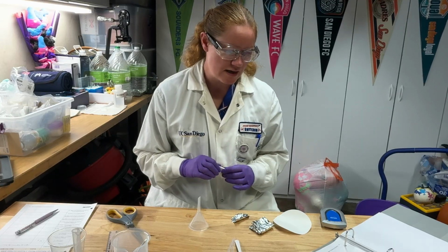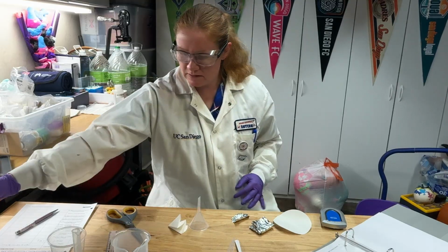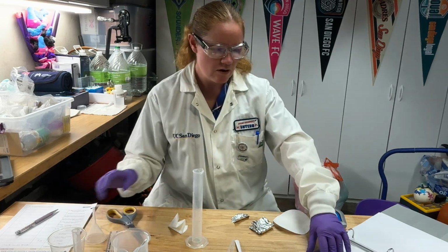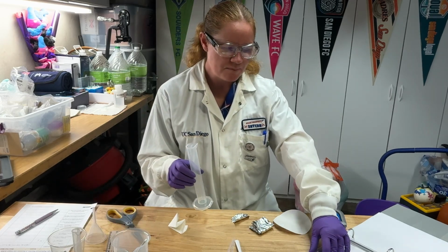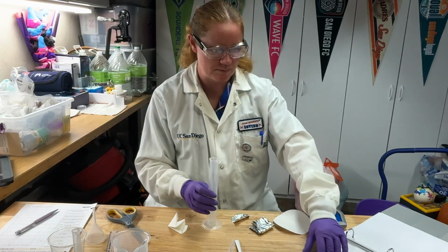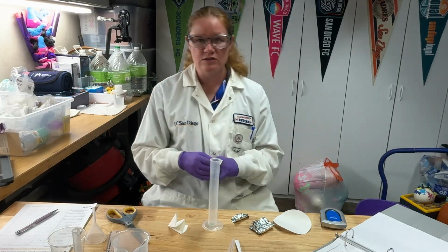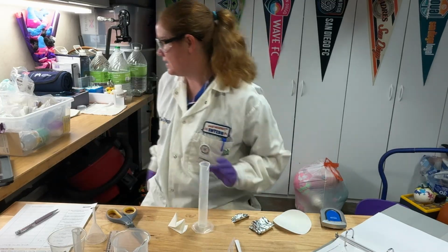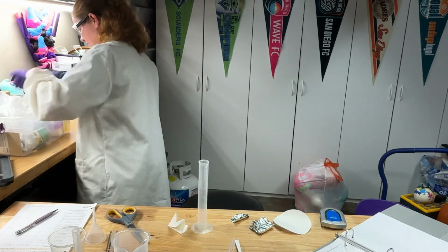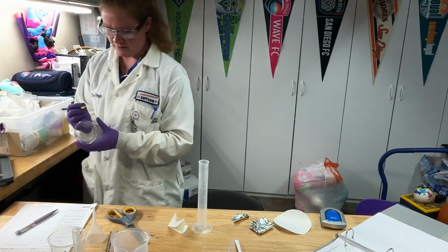Now, this is going to tell you to put your funnel in your graduated cylinder. Well, here's the thing. We've used that graduated cylinder, right? And now it's got a little bit of stuff left in it potentially. So you want to make sure that you are able to rinse this out first. So I'm actually going to get another cup out. Okay, I'm going to use my grease pencil, and I'm going to label this as waste.